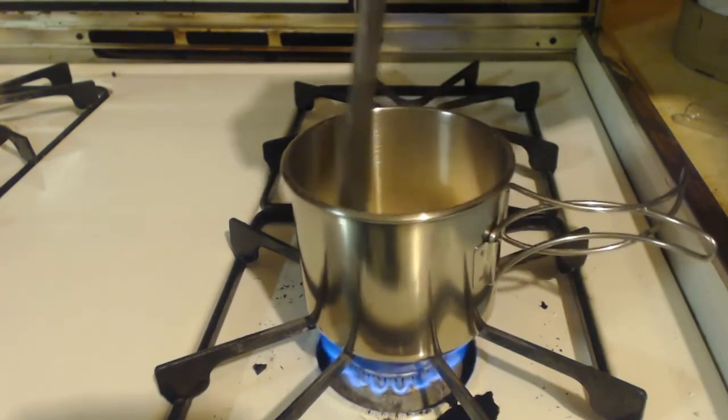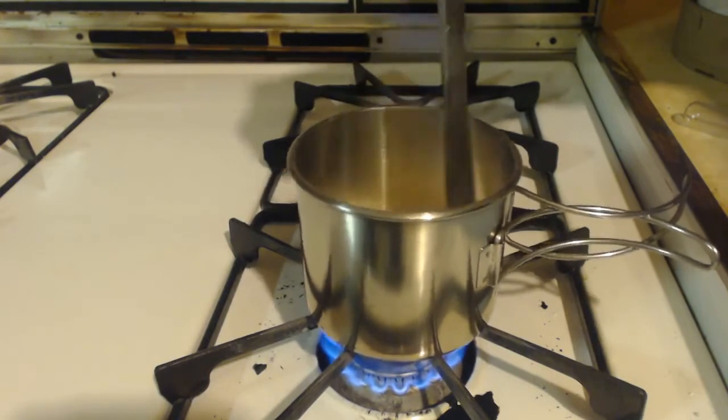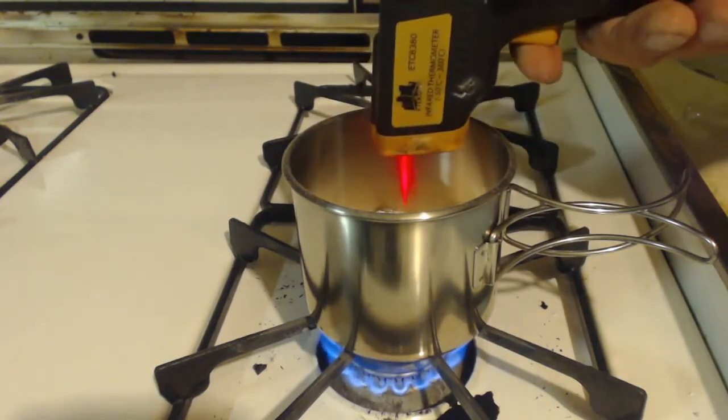It's definitely no water in this. I mean, it's definitely all carbonate, not hydroxide, that's for sure. Let's see what the temp is now.